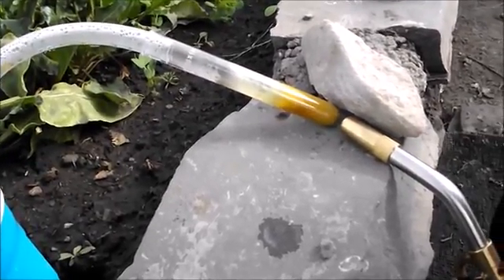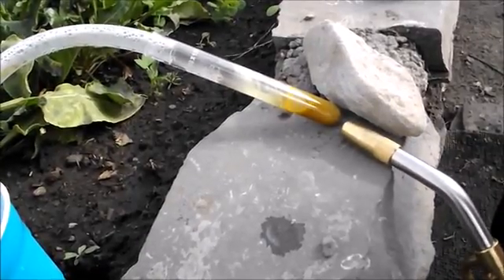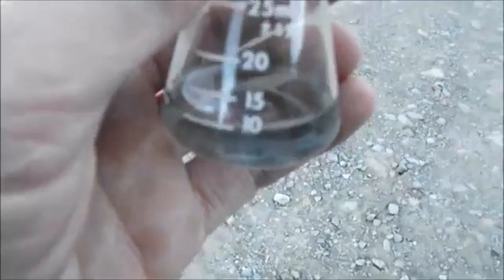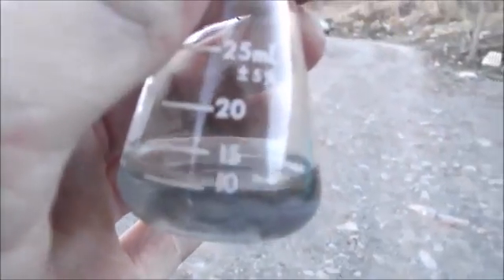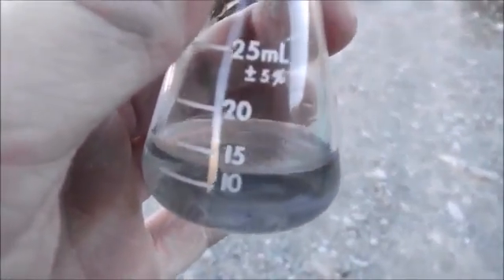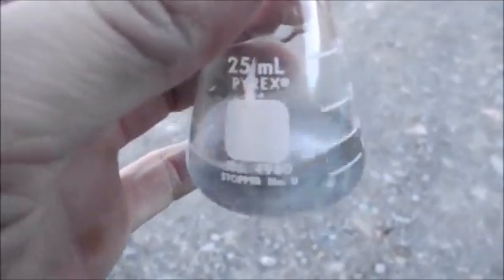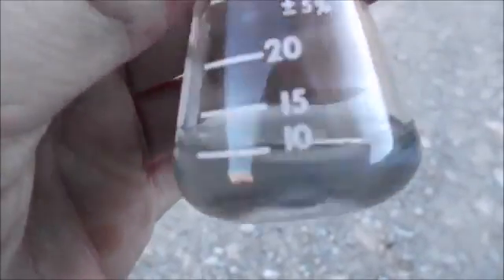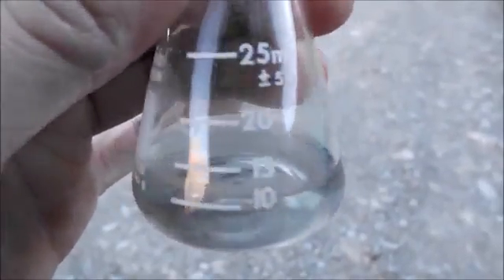Looks like I just got molten salt now, I'm gonna go ahead and keep dehydrating it. Alright, there we have it - looks like I got about between 10 and 15 milliliters of pure water here. This is double distilled, even passed it through a couple of pieces of activated carbon to make sure it's completely deionized. I guess now it's time to go weigh it and see if I have any heavy water in there at all.